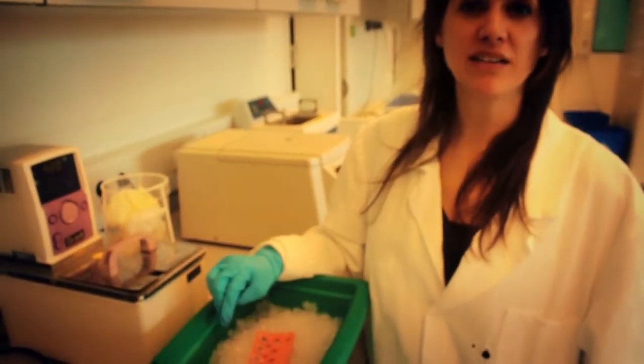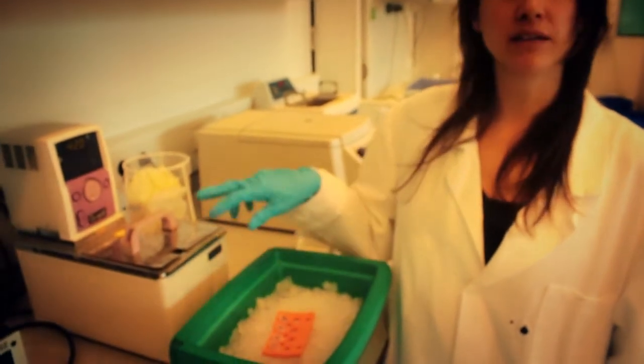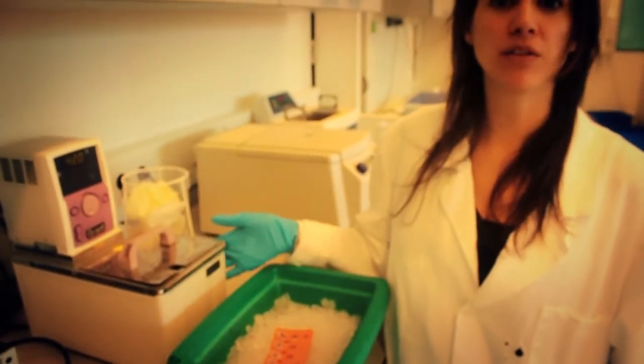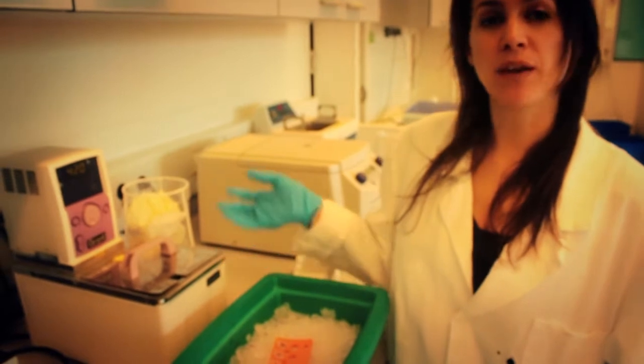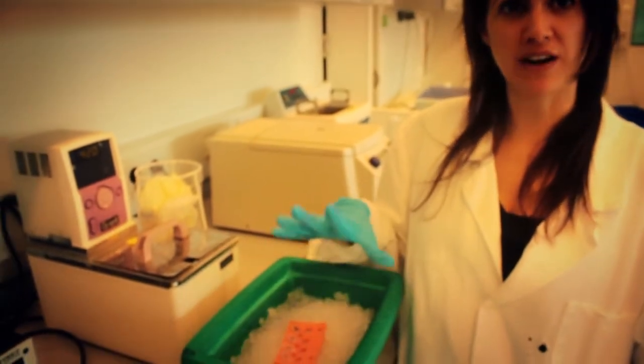Now we're going to do the heat shock. We're going to put them in a hot water bath for one minute and then we're going to put them back on ice for five minutes.